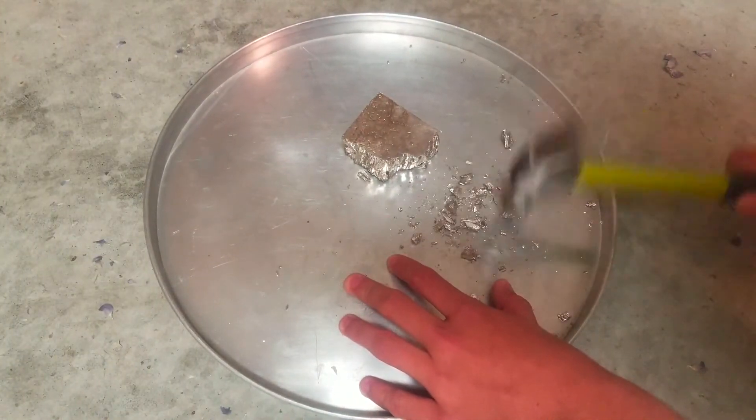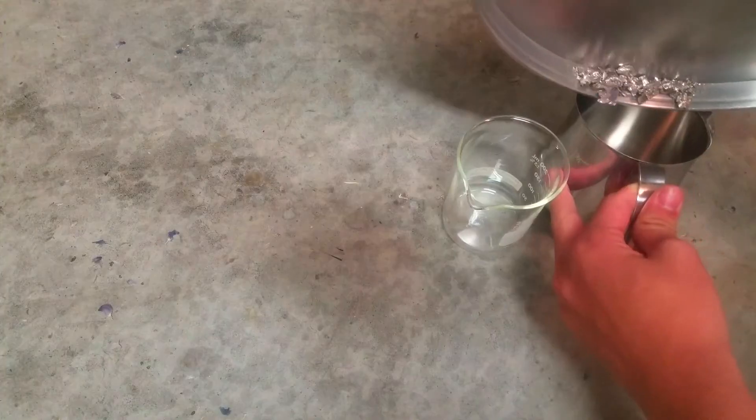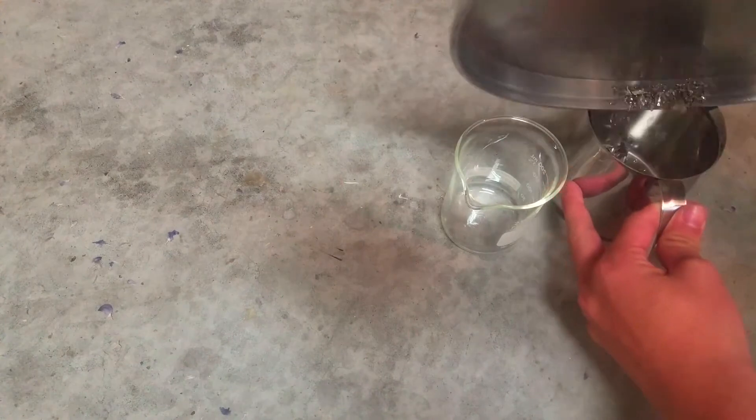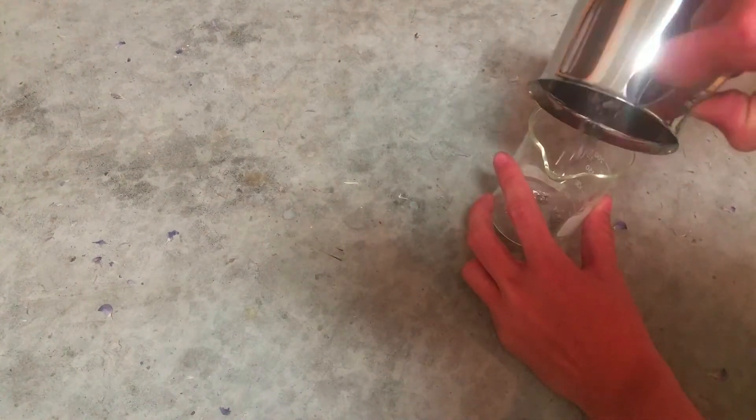Fortunately, it resulted in some good unplanned commentary. I transferred about 50 grams of bismuth metal into a 250ml beaker by first pouring the metal into a metal crucible, and then pouring it into the beaker. I did this purely because I didn't really want to spill my crushed metal onto the concrete floor.